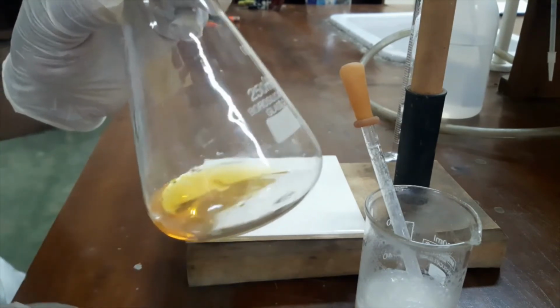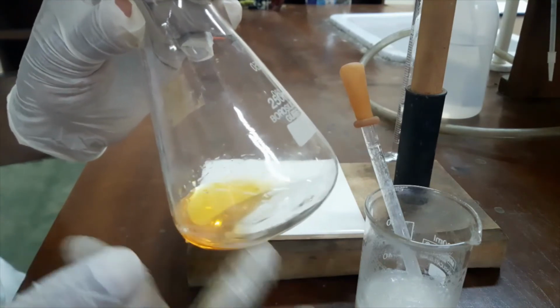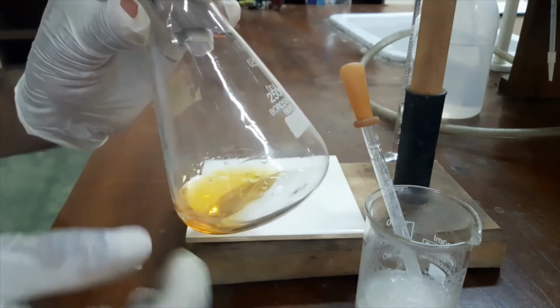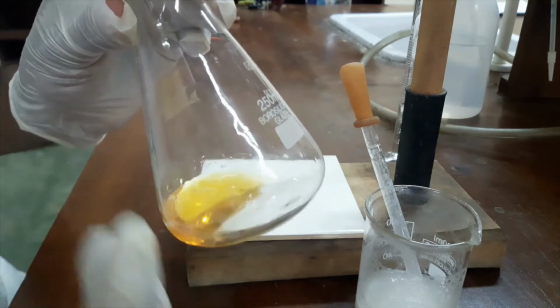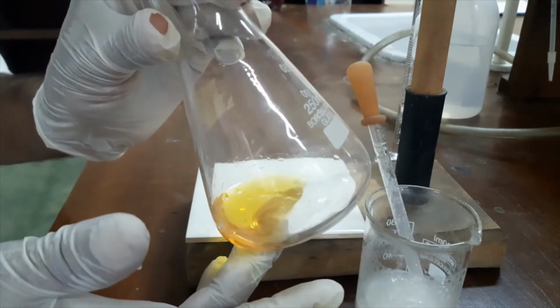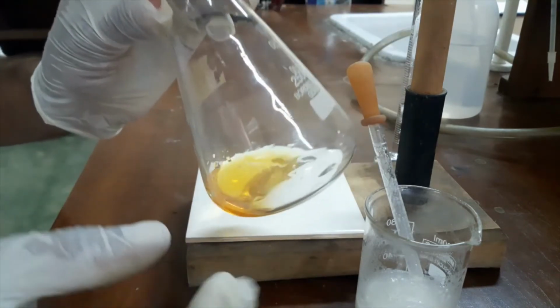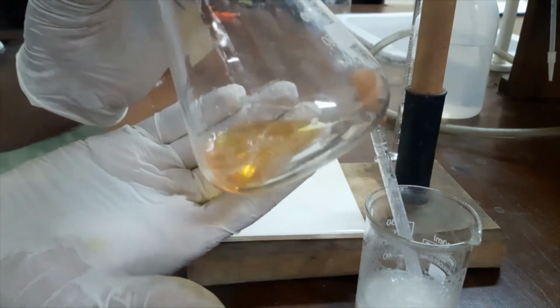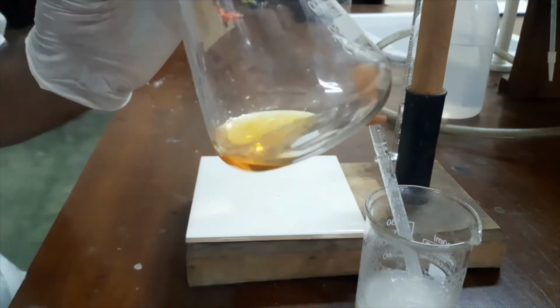However, if we had initially added the starch into this higher concentration of iodine solution, what will happen? The starch and iodine complex will not dissociate back. So we can't observe any color change. So we have to lower the concentration of iodine. So we will titrate this iodine with sodium thiosulfate solution from our burette, and when iodine concentration is low, the dark brown color of this solution will convert into a pale yellow, straw yellow color.